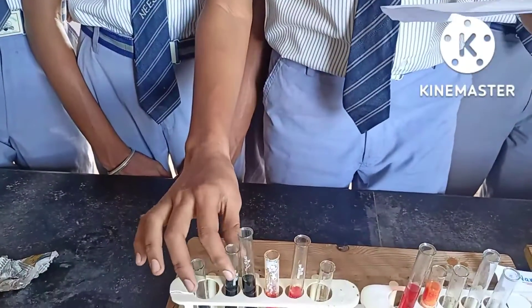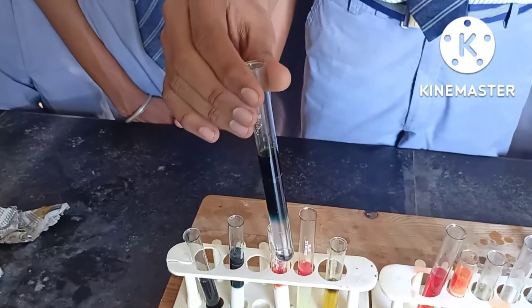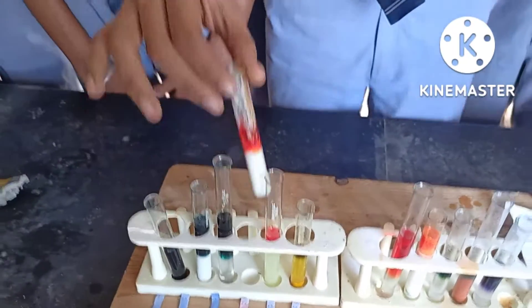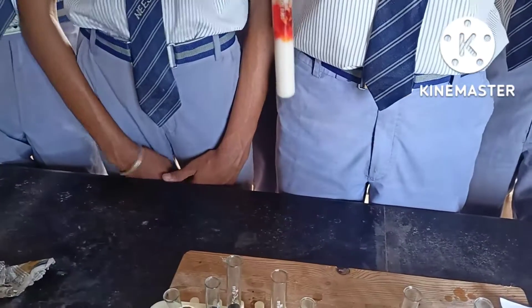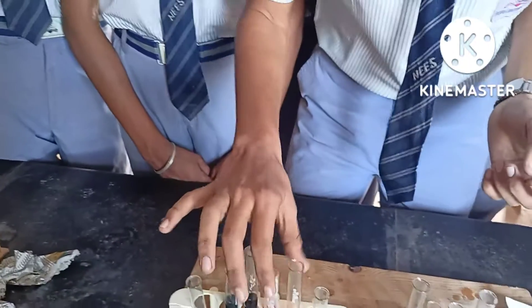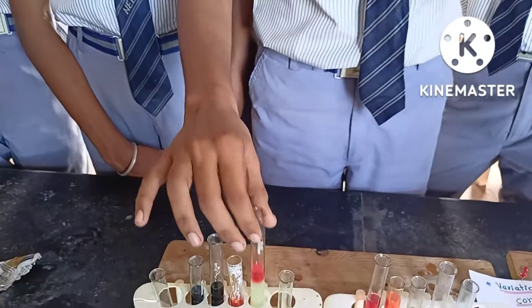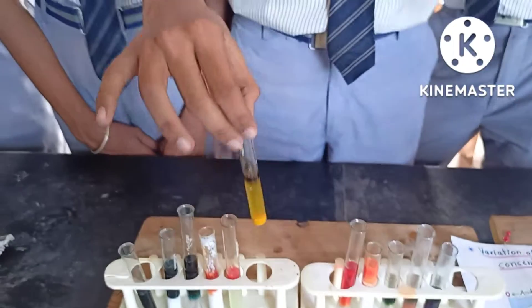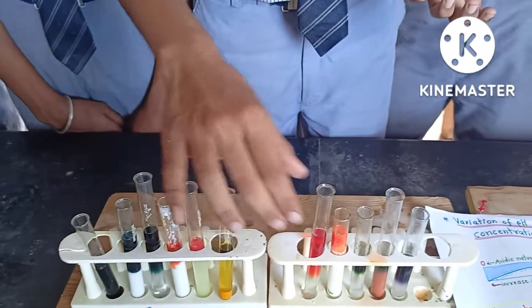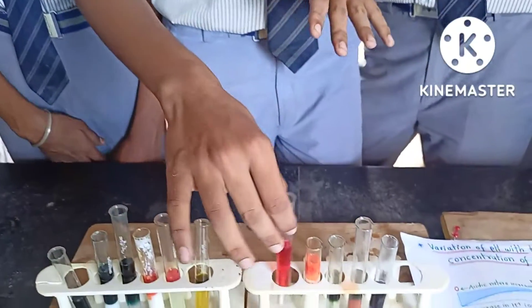For distilled water, pH is found to be 5.4 to 5.7. For curd, the pH is found to be 4.5 to 5.5. For lemon juice, the pH found is between 2 to 3. For turmeric, the pH is found to be 5.9. For vinegar, the pH found is between 2 to 3.